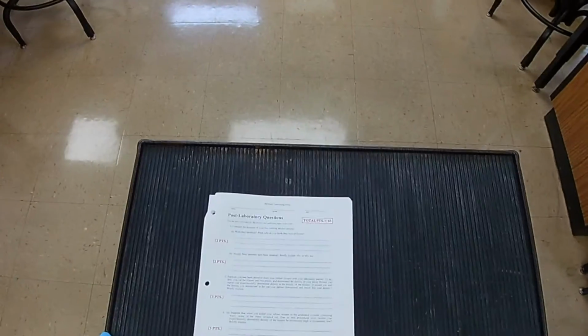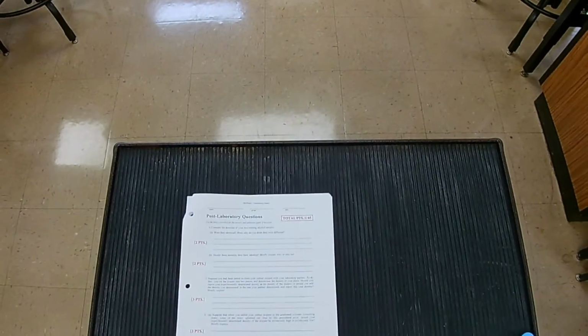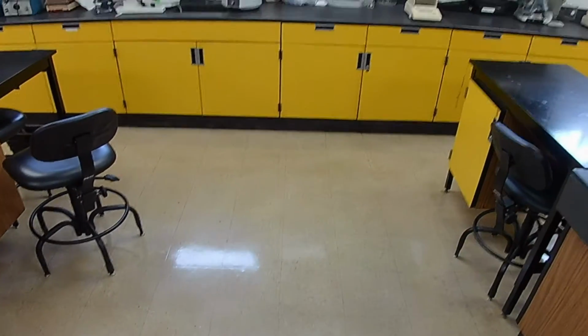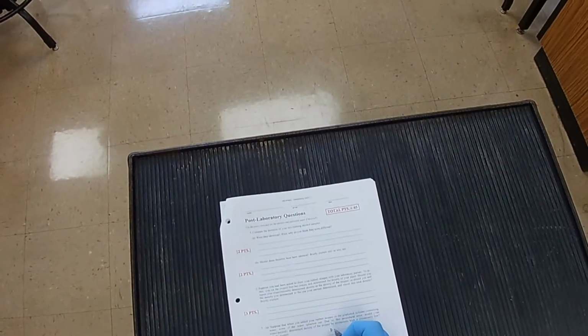So, suppose that when you add your rubber stopper to the graduated cylinder containing water, some of the water splashed out. There's your error. You lost some water. Would your experimentally determined density of the stopper be erroneously high or erroneously low? Answer to that question lies in the formula of density itself. Look, density equals mass divided by volume. So what changed?